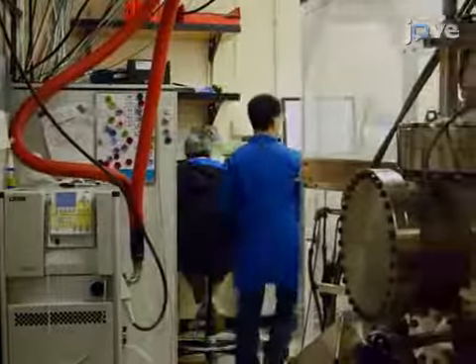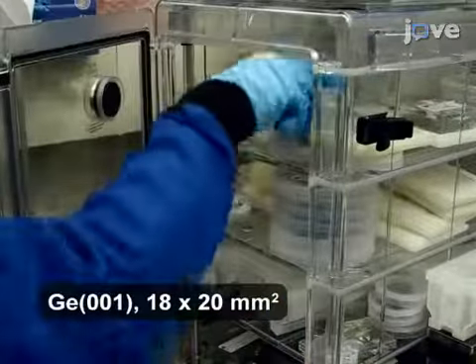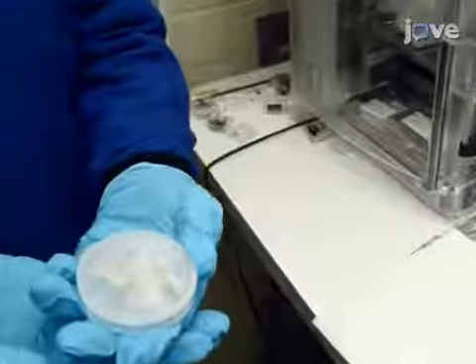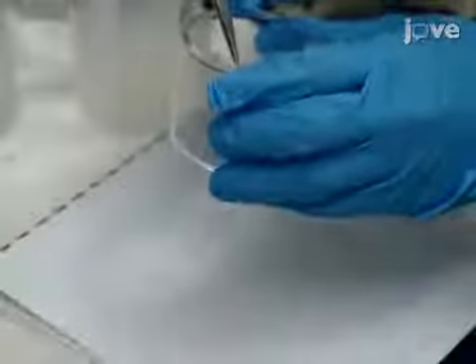For this protocol, use a heavily doped N-type germanium if electrical measurements of the film are needed. Otherwise, all doping levels and dopant types are acceptable. Place a germanium substrate, polished side up, into a small beaker.